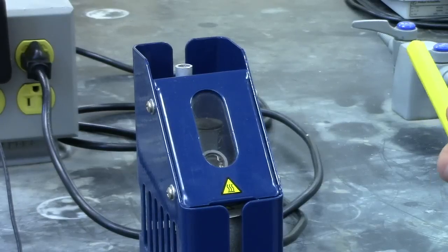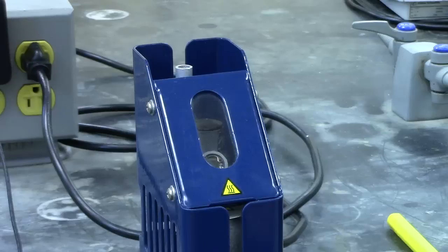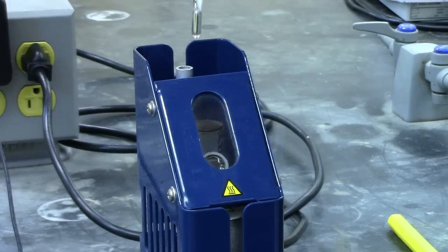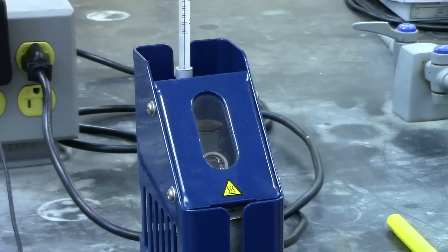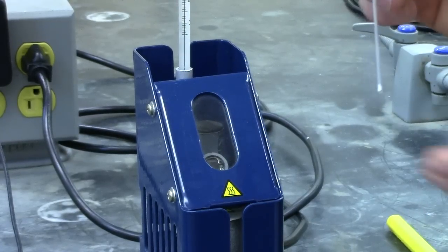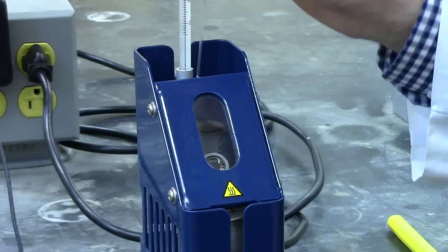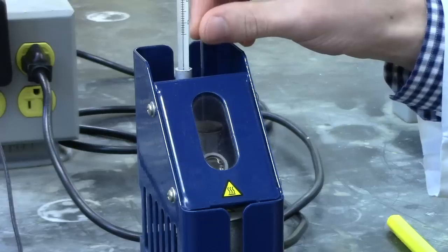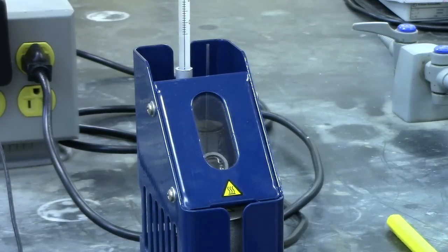To begin with the Mel-Temp, you'll be putting in a 400 degrees Celsius thermometer. The thermometer goes in the top gray shaft of the Mel-Temp itself. With the well-compacted sample, as you can see in the bottom of the capillary, this will go in one of three slots located just in front of where the thermometer enters into the Mel-Temp.